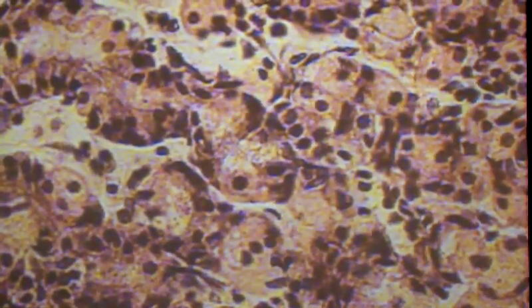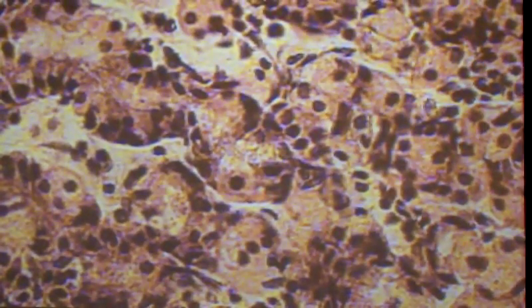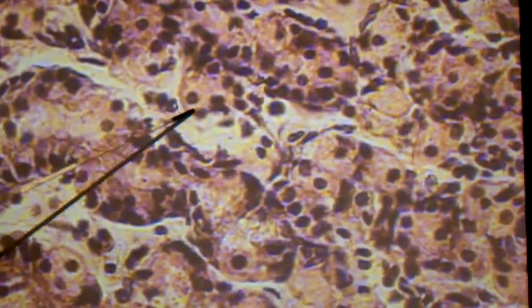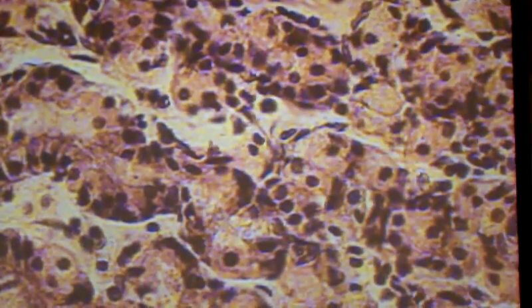Once you get past the layer of the gastric pits into the gastric glands, that's where you find them. Here's another one right here. On certain slides, you're going to see a whole bunch of these. They're stained slightly differently and tend to jump out a bit more clearly. On those slides, the cytoplasm will be a bit pinker — it's not as grainy as this.